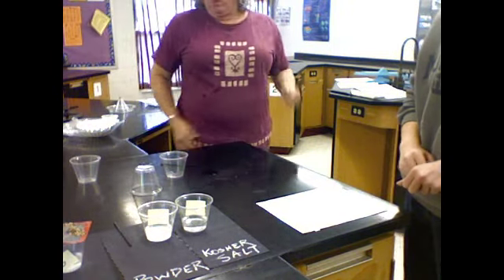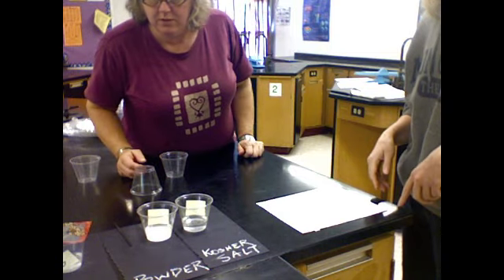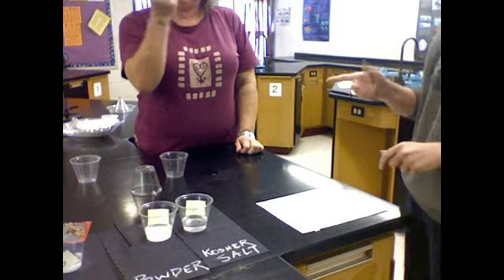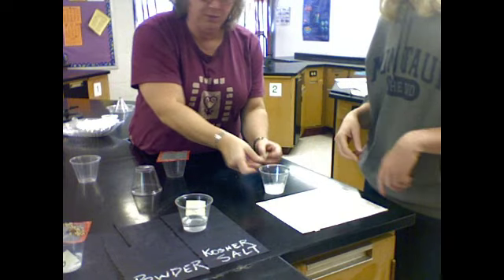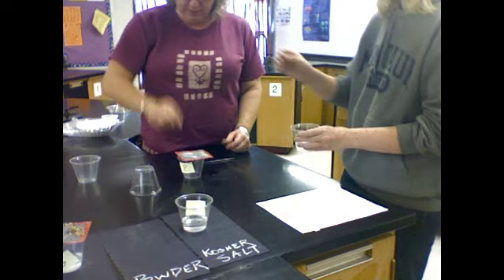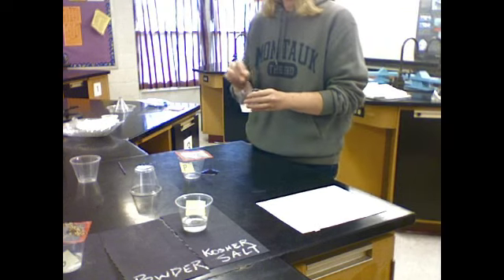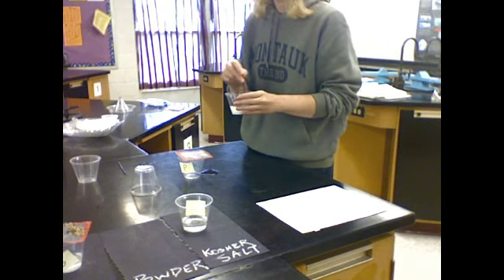Okay, what's next? Well, then next we need to try that same procedure, that same step, using the powder. I just happen to have another screen here. You were well prepared. Do you want to do this one? Sure. It is important in lab groups to share, isn't it? Here's a stirrer for you. We don't want to cross-contaminate. I'm going to get something to clean up that spill. All right, so I'm going to stir the mixture thoroughly before we start to pour it through the cup.